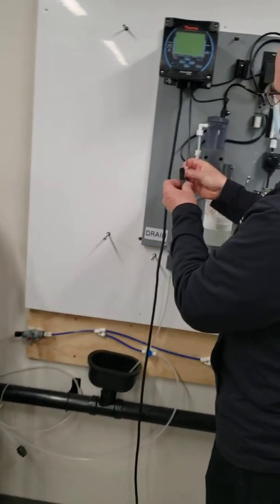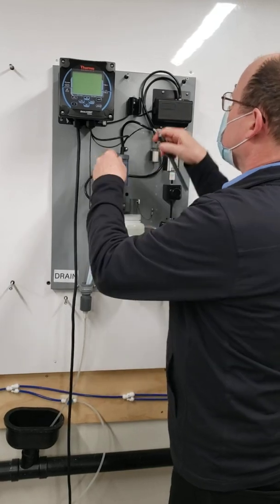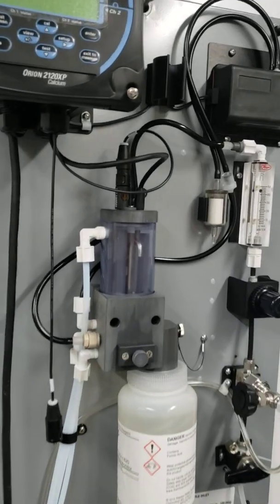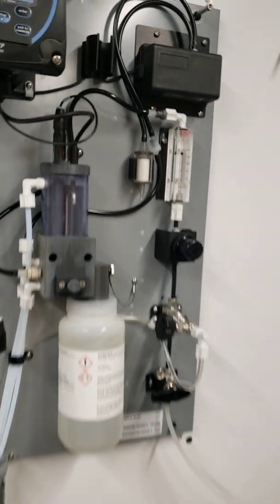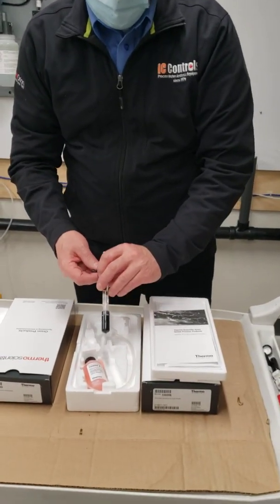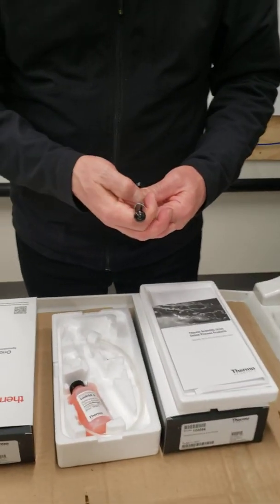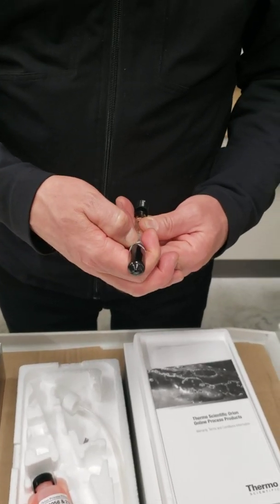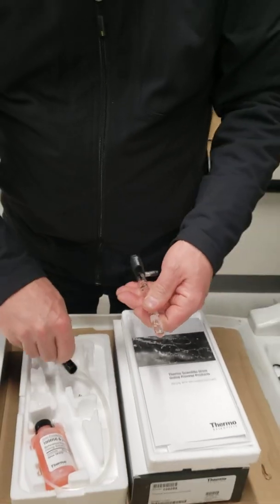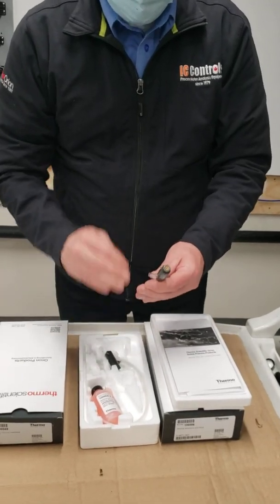Hook that up to the lead that says 'sensing' — the hardness probe goes in the front. Then grab the reference probe out of the box and take the parafilm off. Just use your fingernail, squirt a little bit through the tubing, pull it off, and do the same with the sidearm. Be very careful with the sidearm not to put any torque on it.